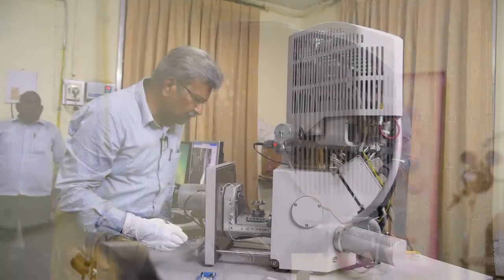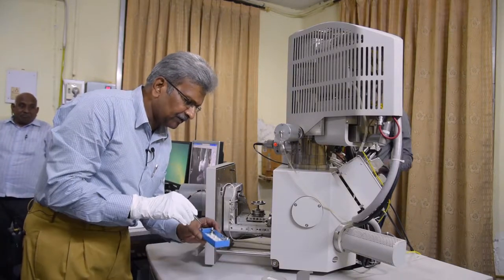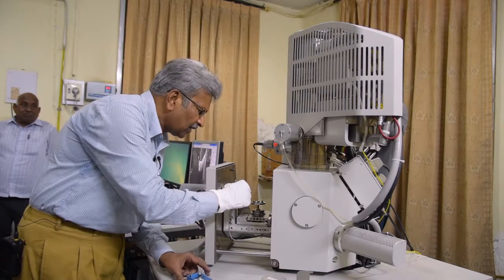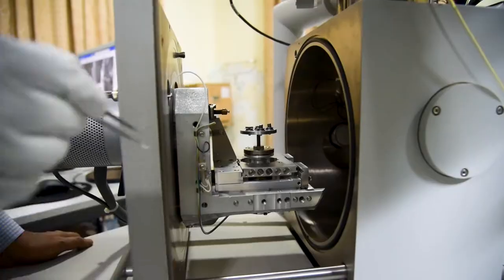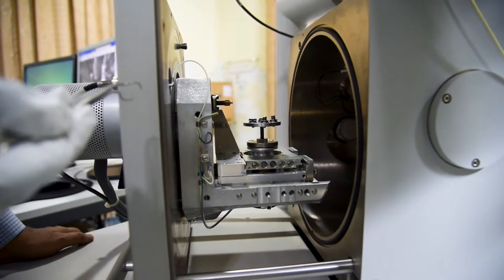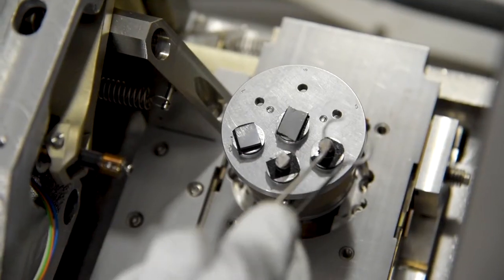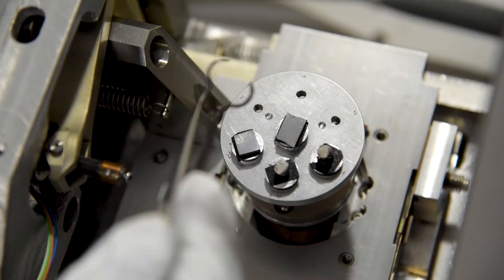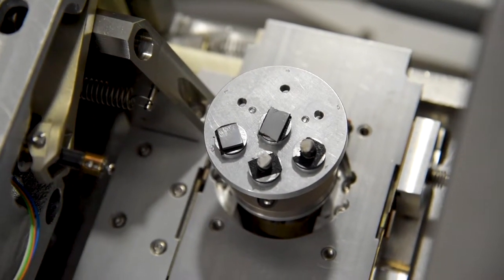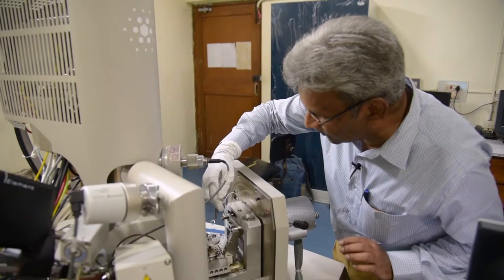Now, the specimen I have shown you is placed one by one onto the specimen mounting stage. As you can see, there are 6 slots on the periphery and a 7th one right in the middle of it — so 7 specimens can be loaded together. If you give me a specimen of 1 centimeter square with a thickness of 5 to 6 millimeters, we will not have any difficulty conducting this experiment.